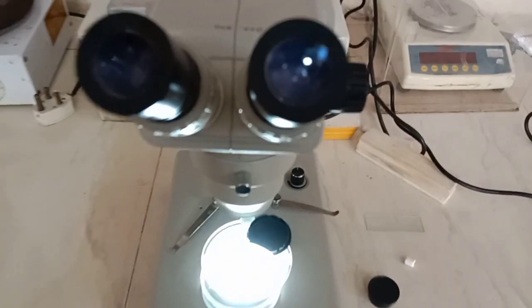Now you can clearly see the soil nematodes under this stereo microscope. You can see the movement of these soil nematodes, which are directly being focused on this stereo microscope.